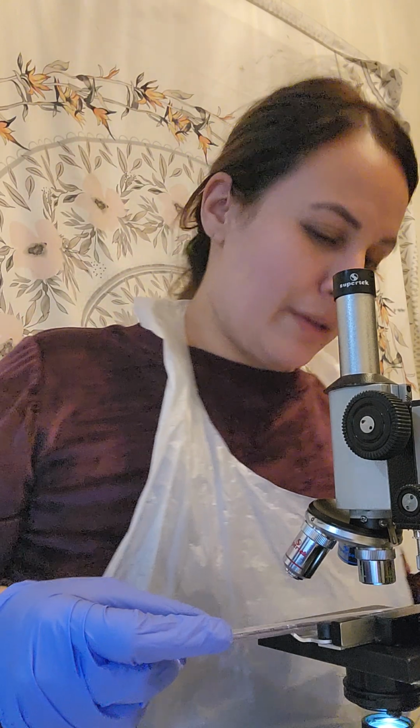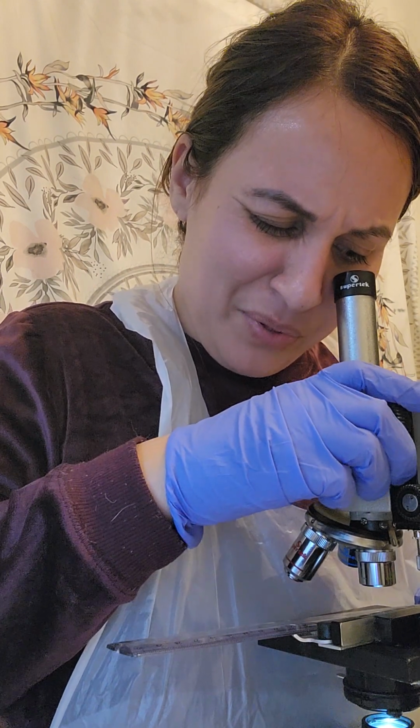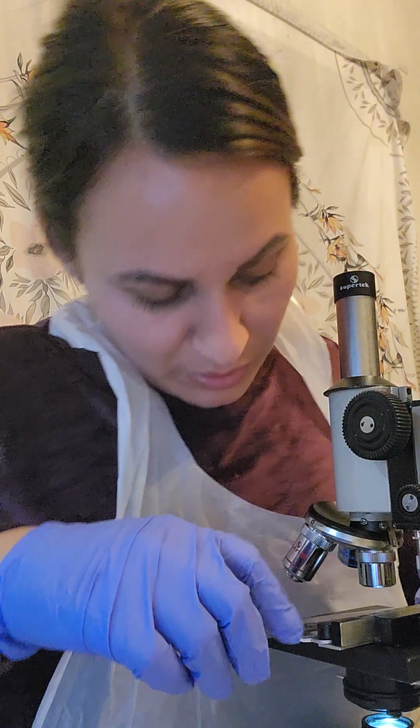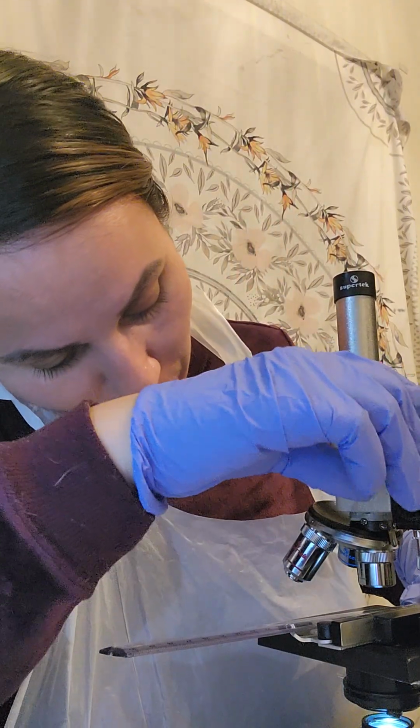The field of view is the circle visible through the lens, the diameter. First it wants us to start on the ruler with the lowest power. Record the approximate field of view. I'm going to start with the 4x here. And per your suggestion, Professor, you were very helpful.